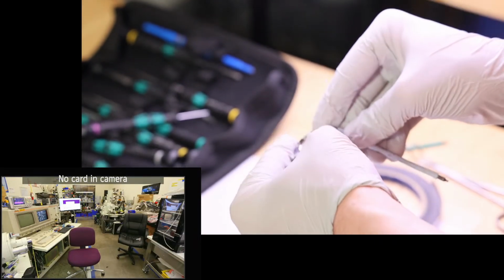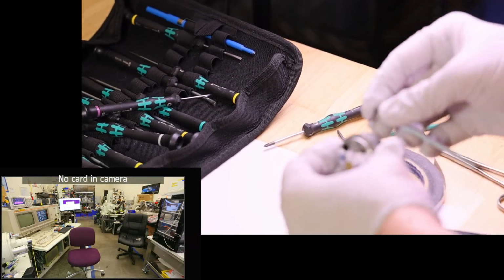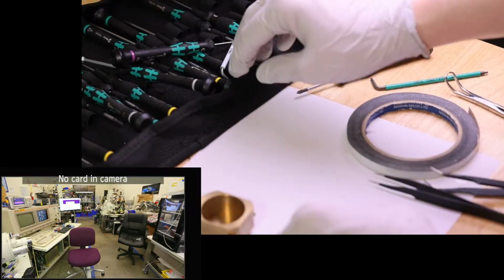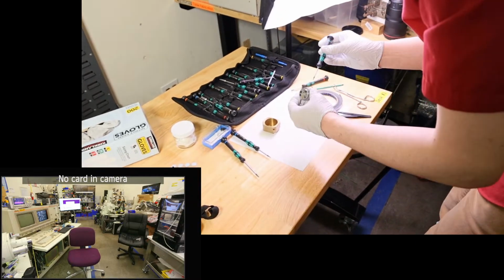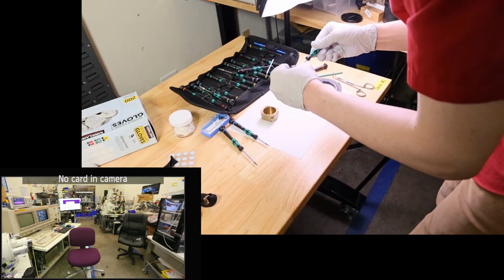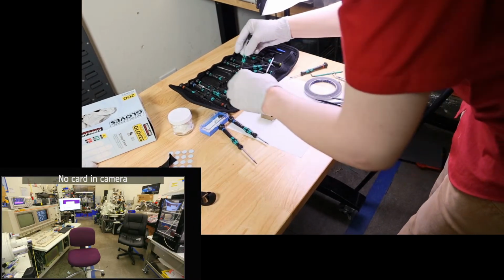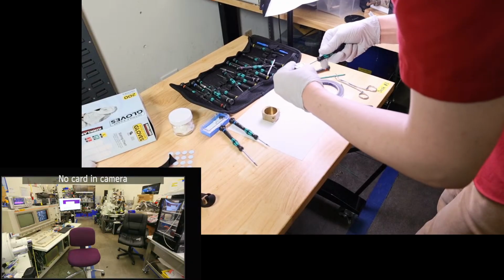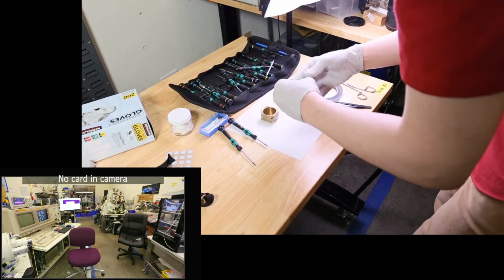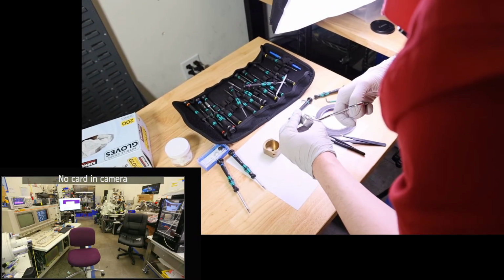So will this one reach? Apparently not. I think I got something else that'll work though. That should do the trick, I bet. Okay, one size up from that, maybe. There we go, that did it. Now that loosened the set screw, but we're still a little bit stuck in there.